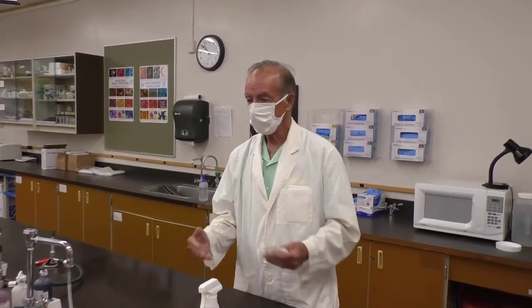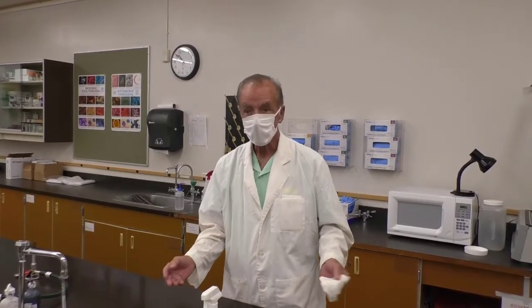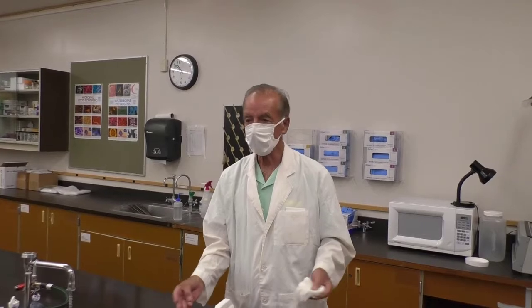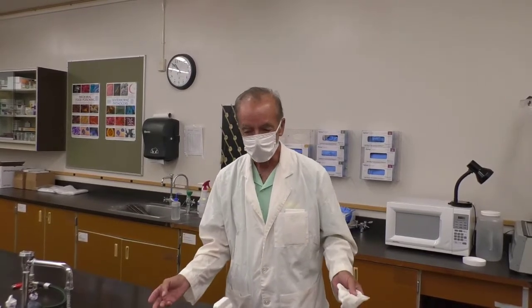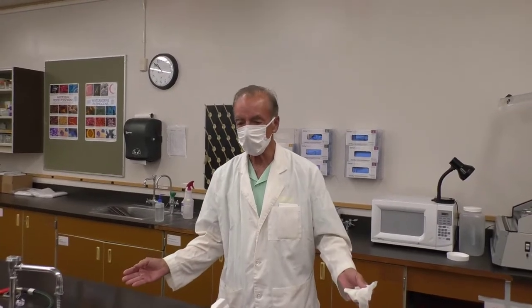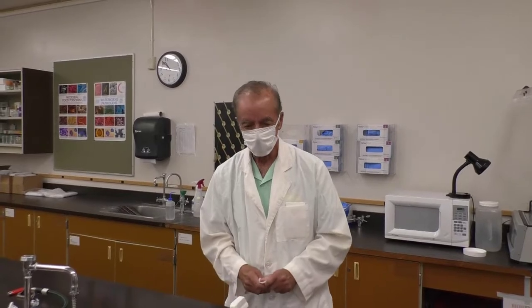There are different microorganisms that are used in the laboratory. We make the assumption that a lot of the organisms are potentially pathogenic, even though they may only be opportunistic in terms of their ability to produce disease. We treat all the organisms that we work with care and caution, so we try to control where they are.